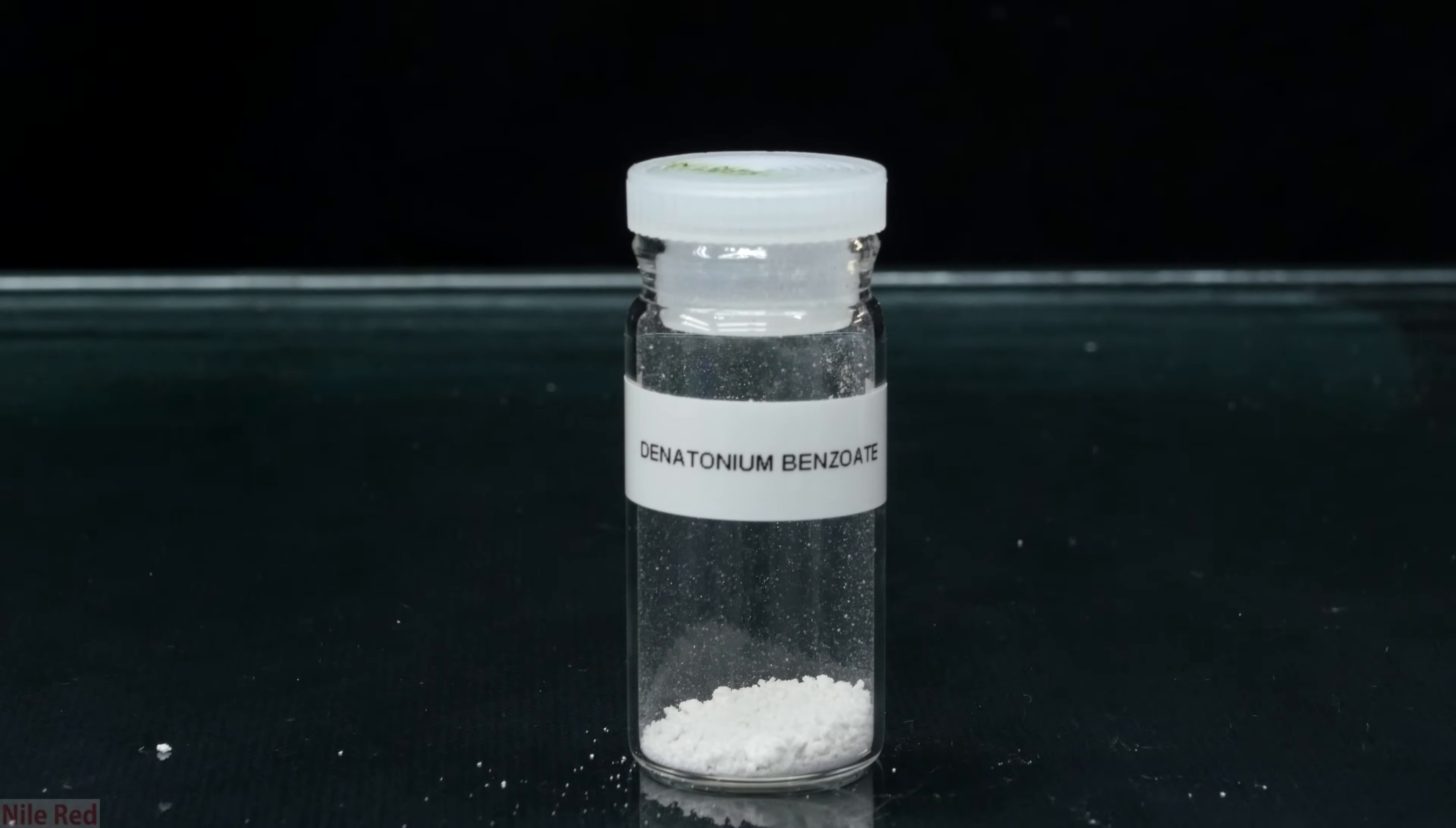The final yield was about 0.6 grams, which is actually really bad. In the end though, the denatonium benzoate is so potent that it doesn't really matter that the yield is so low. I don't really have a test to show you guys, but just believe me when I say that a very small amount of denatonium benzoate is very unpleasant.